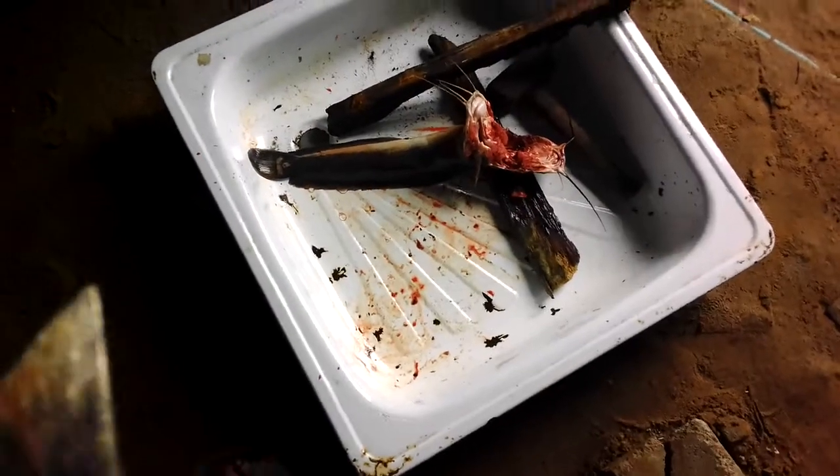This pituitary — this brain of the catfish — is used to release eggs from even a 2 kg, 2.5 kg, up to 3 kg female catfish. This one alone can save you from spending 5,000 naira to buy a bottle of ovulation chemical from the market. Crush it with a salt water solution, get 2 to 4 ml, and give each 1 kg fish about 2 ml. Within the next 10 hours they will promptly and easily release their eggs.